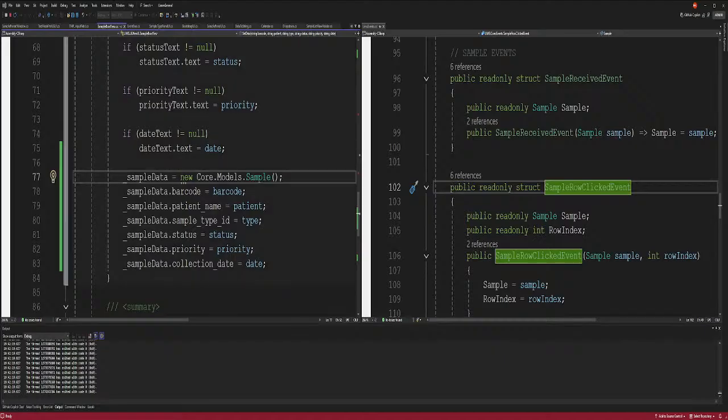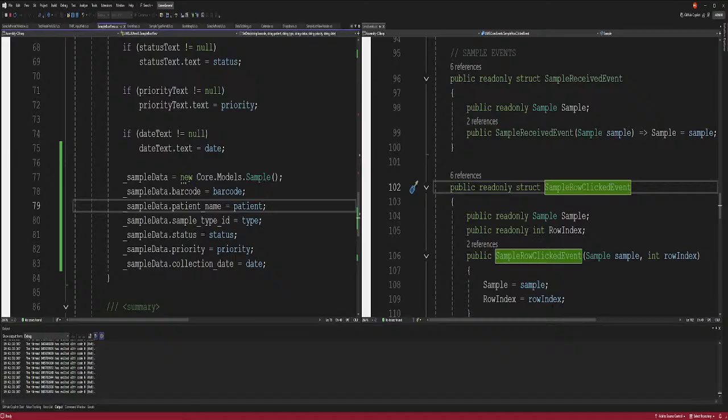It just takes so long to load. Well, anyway, why it's loading, why did we have to do that? Because this was null, and you can't assign null, so you have to make an object. So what I did was I used the type new to the actual model, to the actual class. So I made it into an object instead of being null. You can't assign null to anything like that.